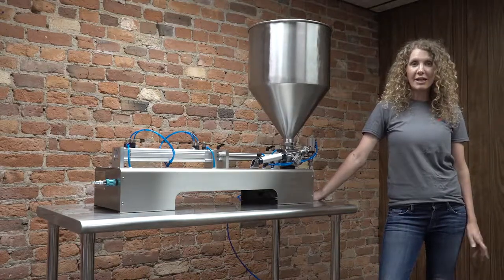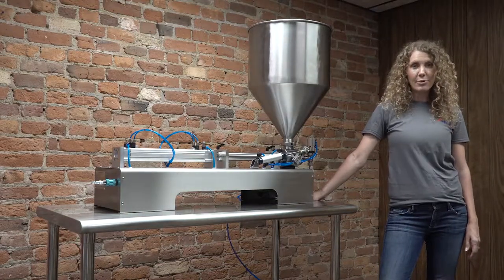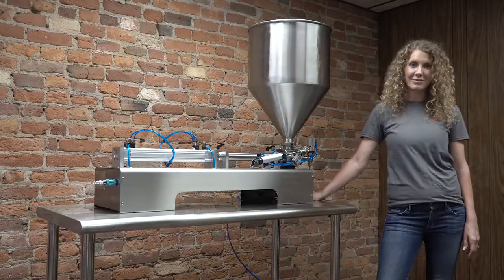Hi, my name is Alicia with Apex Filling and today I'm going to demonstrate how to disassemble the tabletop piston filler for cleaning.